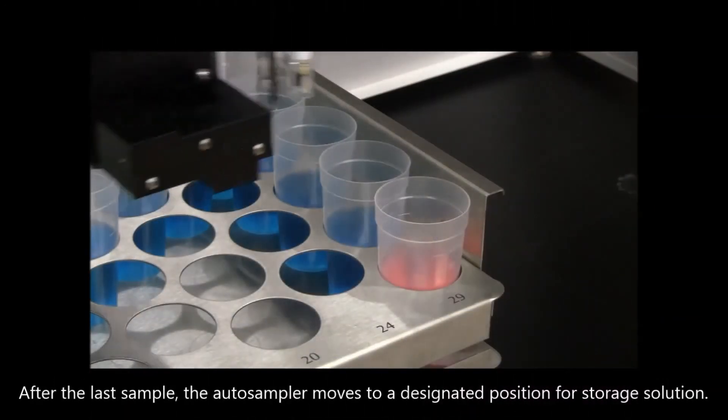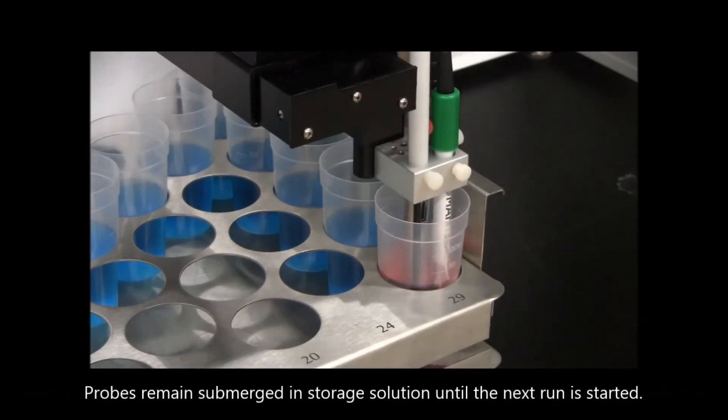After the last sample, the autosampler moves to a designated position for storage solution. The probes remain submerged in storage solution until the next run is started.